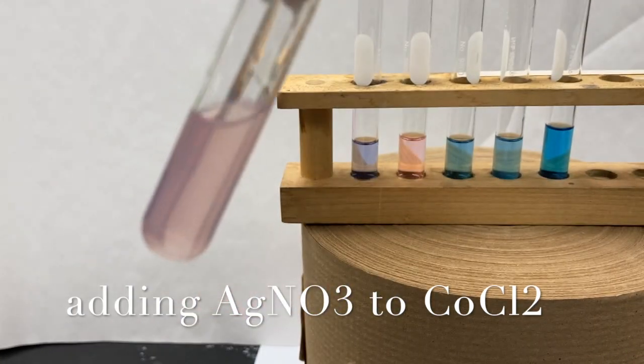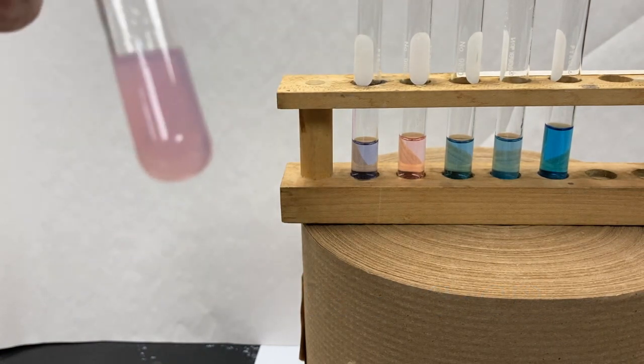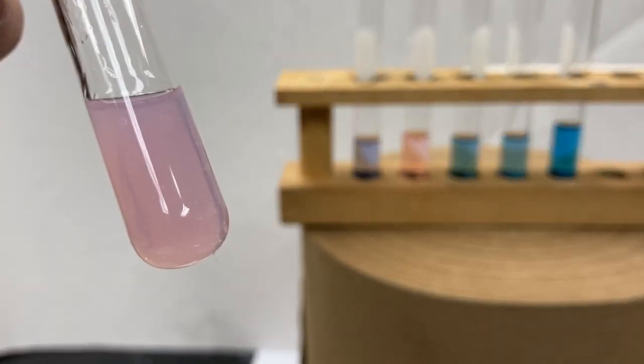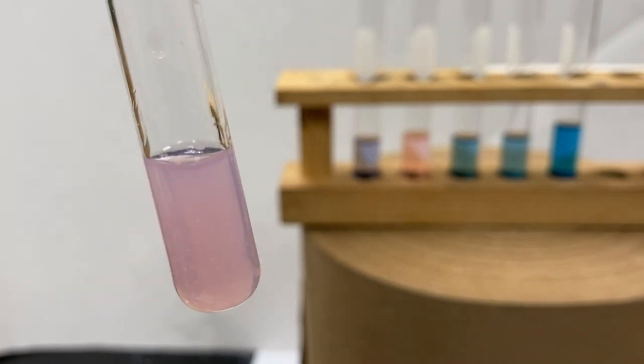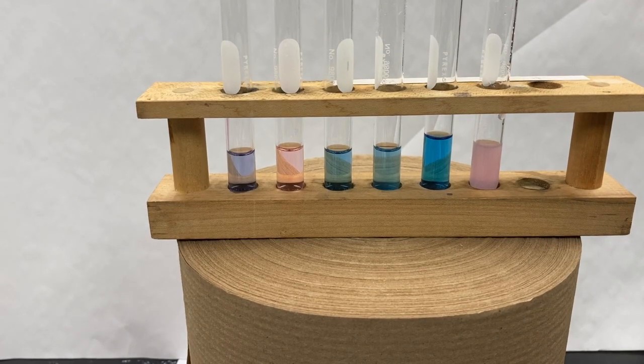So we get a pink color to return, and we get some cloudiness, some precipitate. Which, if you know your solubility rules, that should make sense. Here are the 6 tubes again from left to right.